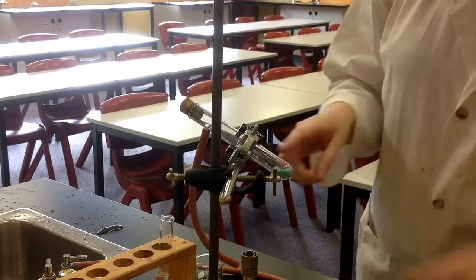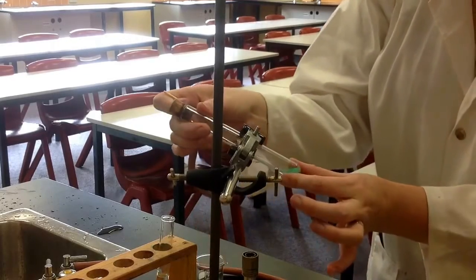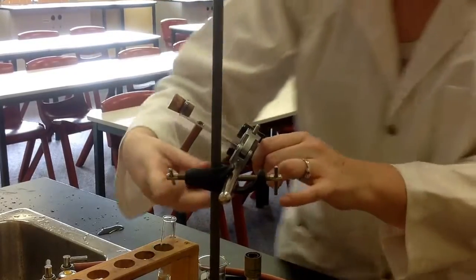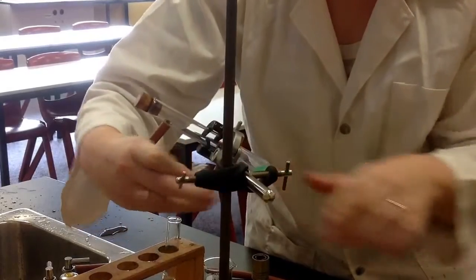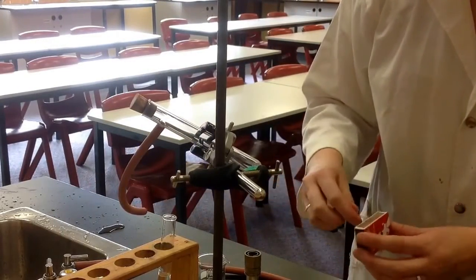Today I've picked the carbonate, copper carbonate. It's a beautiful green color and the reason I like to pick it is because it does spectacular color changes which highlights the reaction going on here.